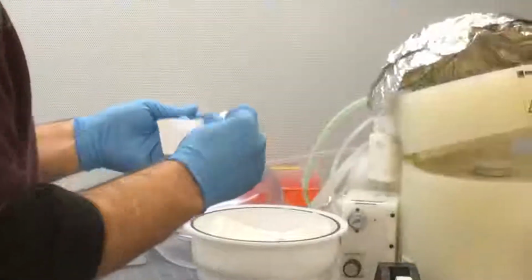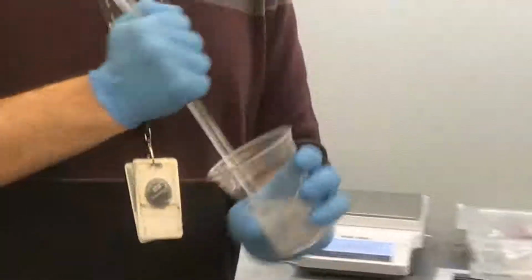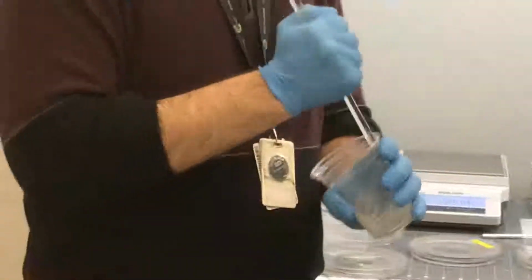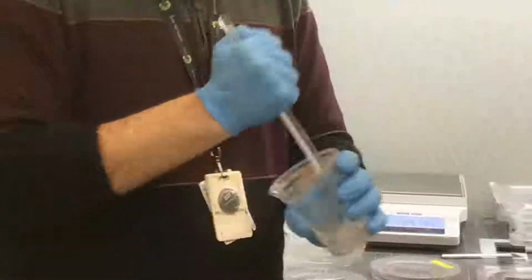Then with a completely clean glass rod, it should be completely clean and particle free. So we clean it at first. We make it particle free with the air to remove all the particles. Then we mix. Normally, based on the weight, for example for 40 gram, it takes around 3 minutes to complete the mixing.